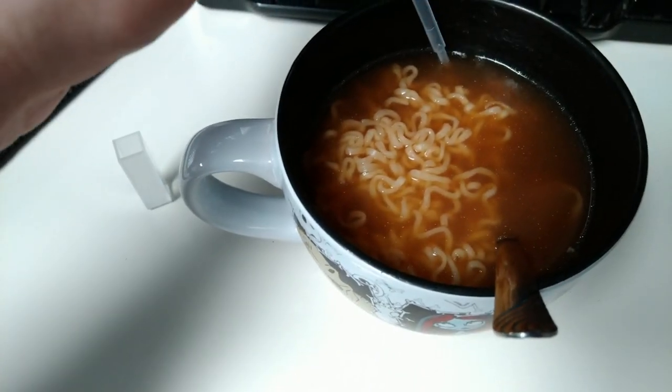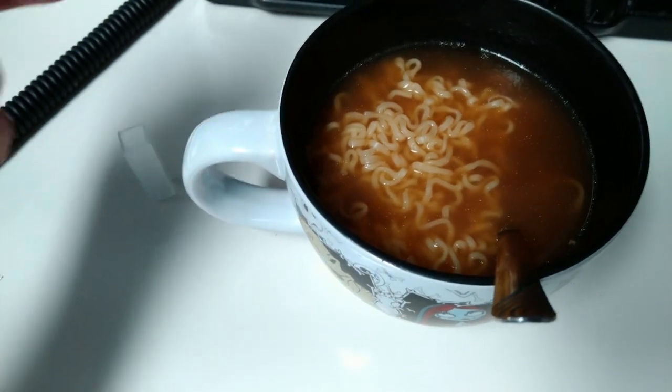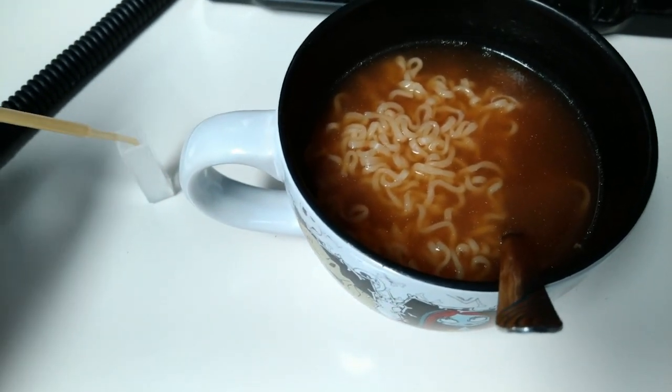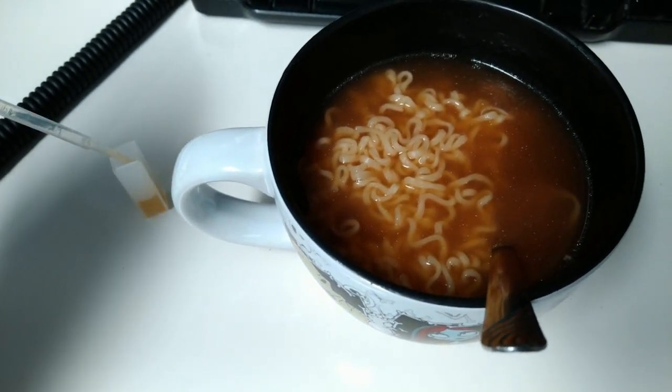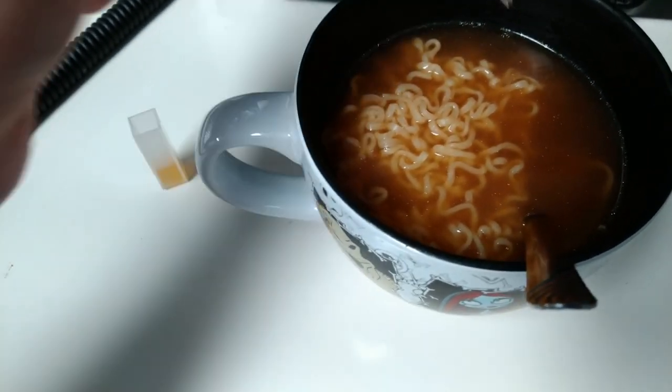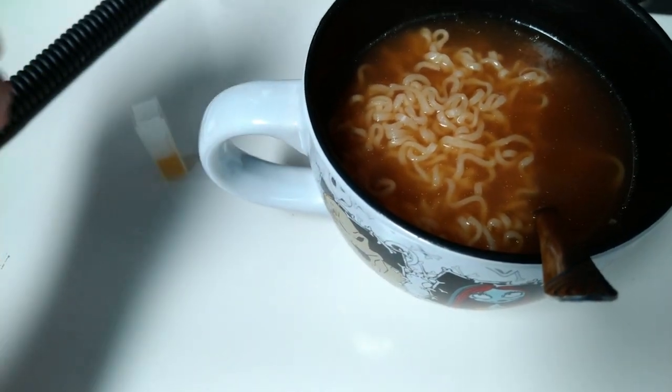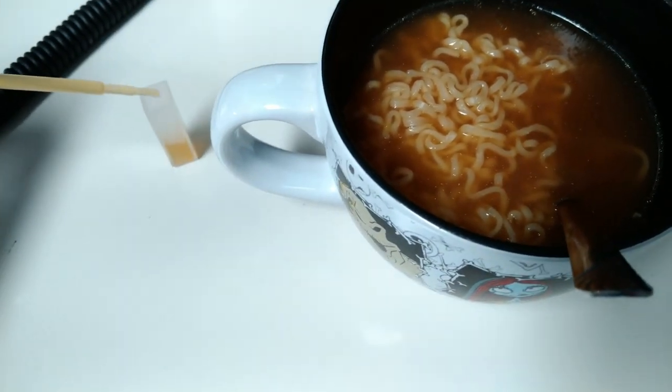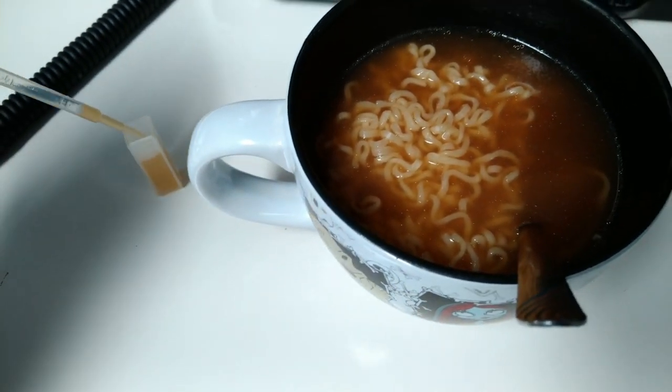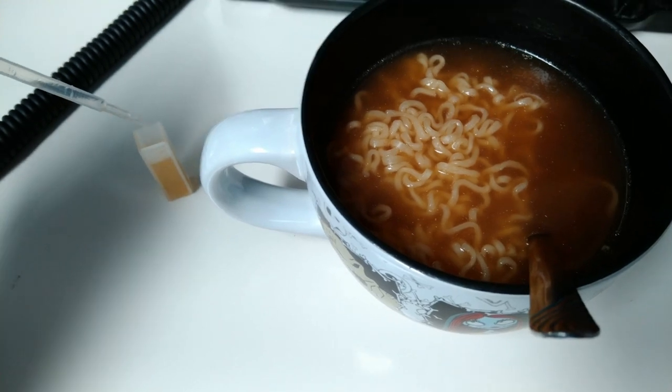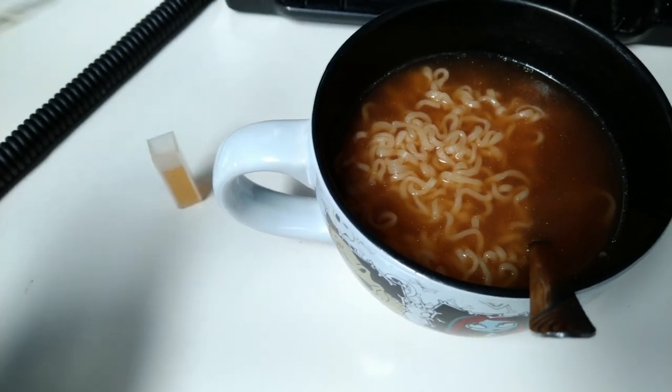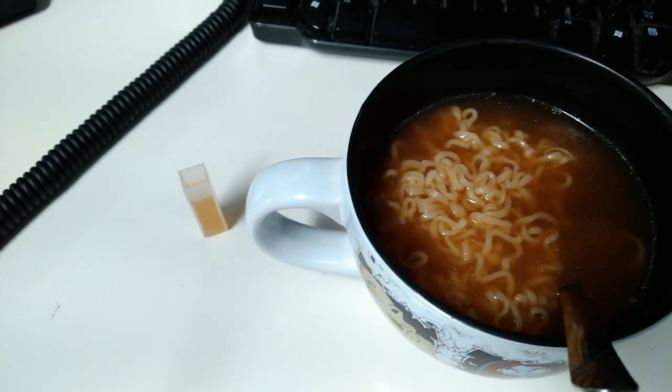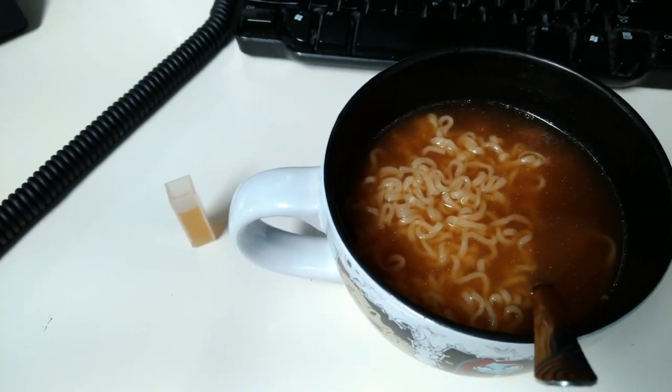I just made another batch of ramen. This one is beef and we're going to go take a sample of that and then pop into the lab and check it out while I'm waiting for it to cool. I do actually plan to eat this so I did grab a fresh food grade pipette right out of the package.